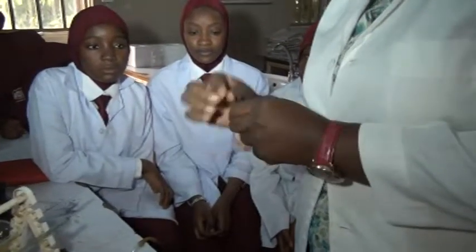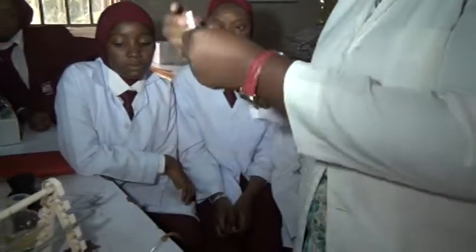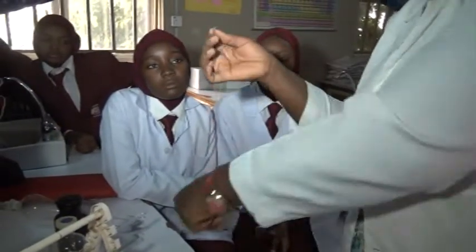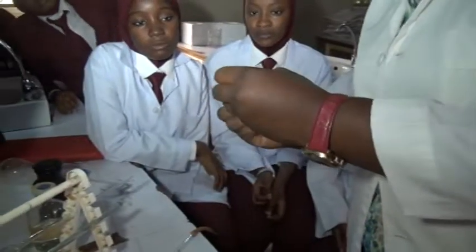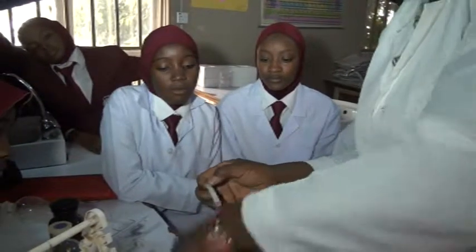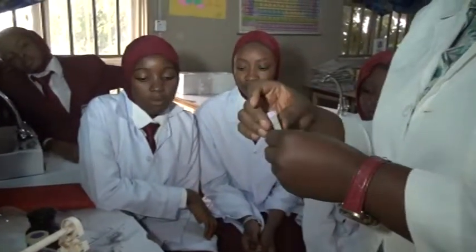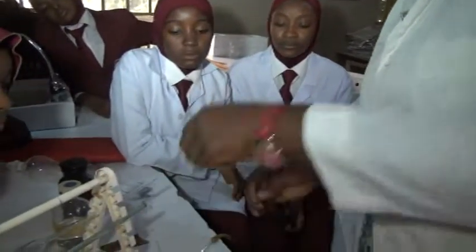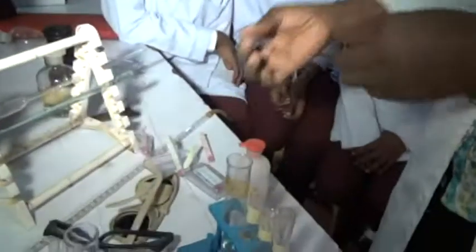You take a strip, just a little of it, don't use the bunch. Take a piece of this red litmus paper. You also take that of blue litmus paper. Now you don't know which is which, but we want to know.